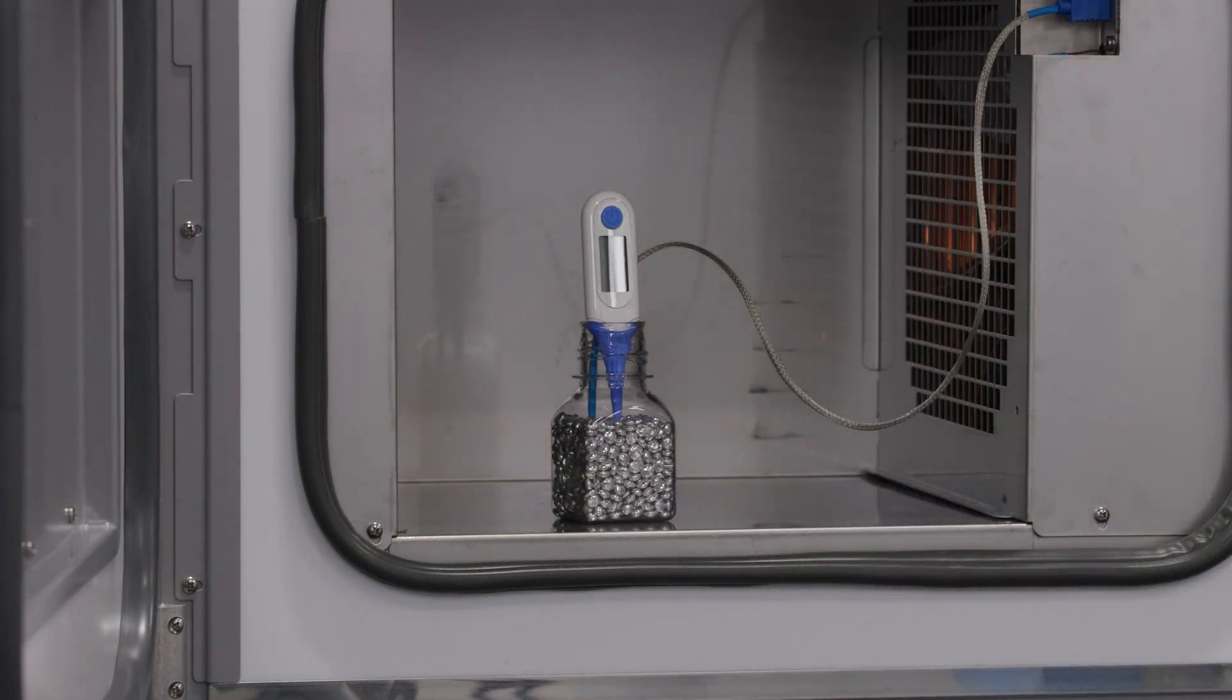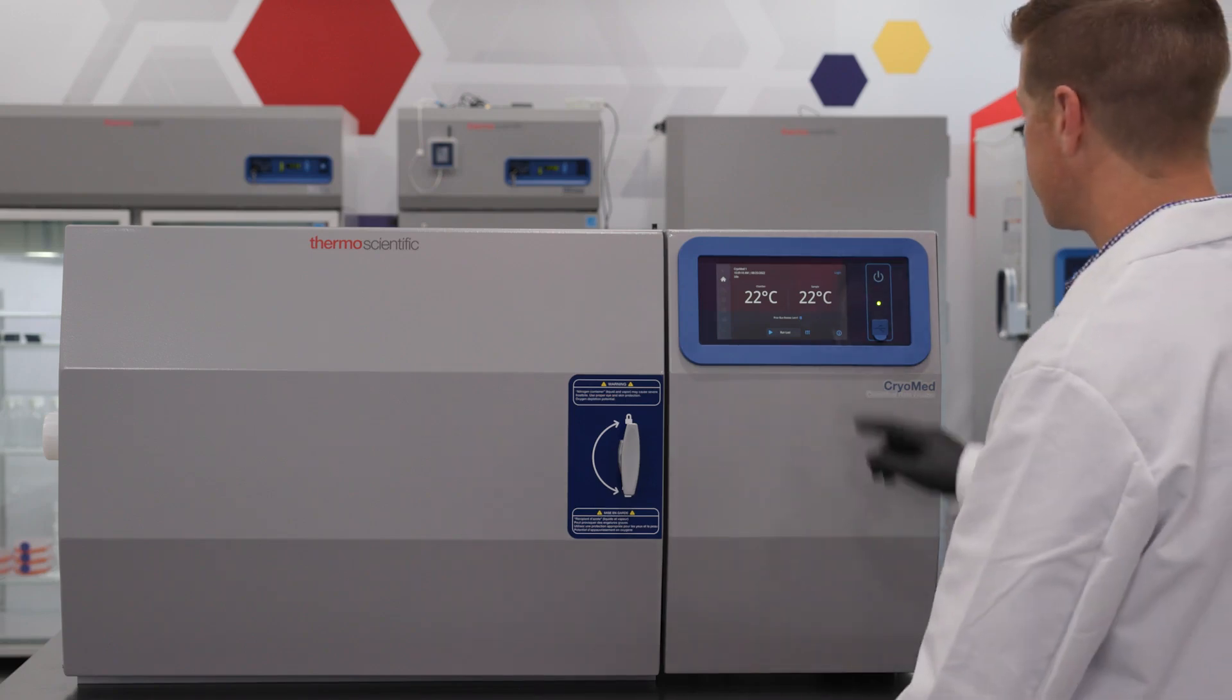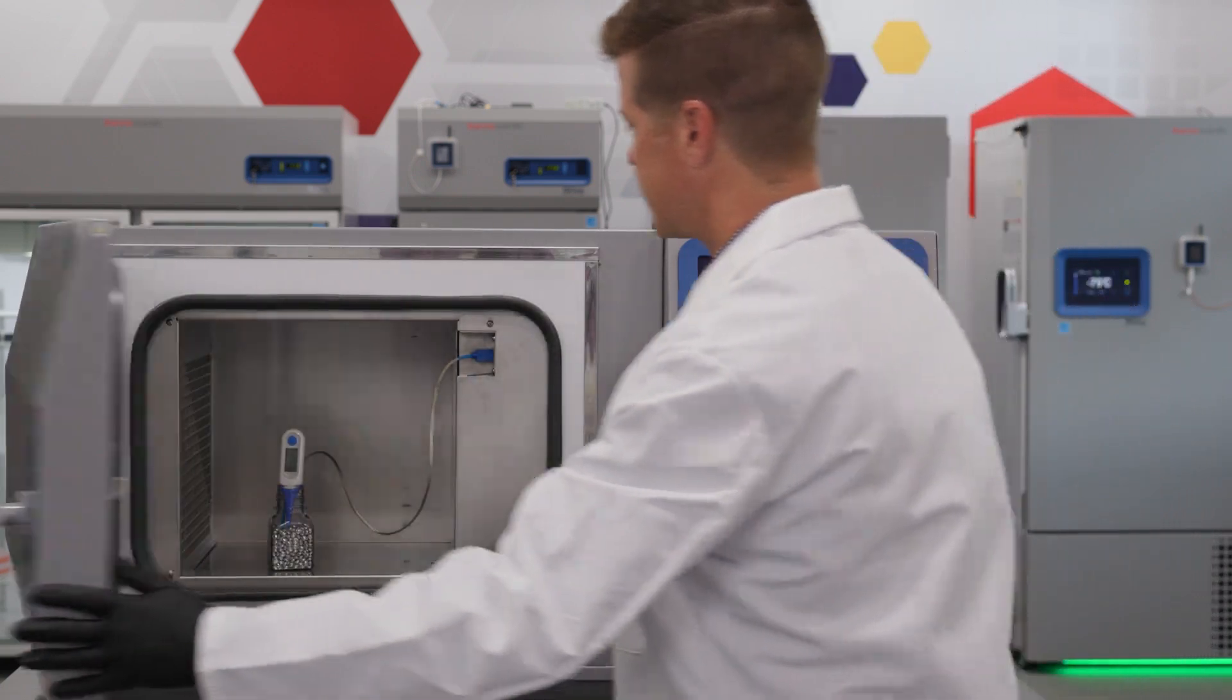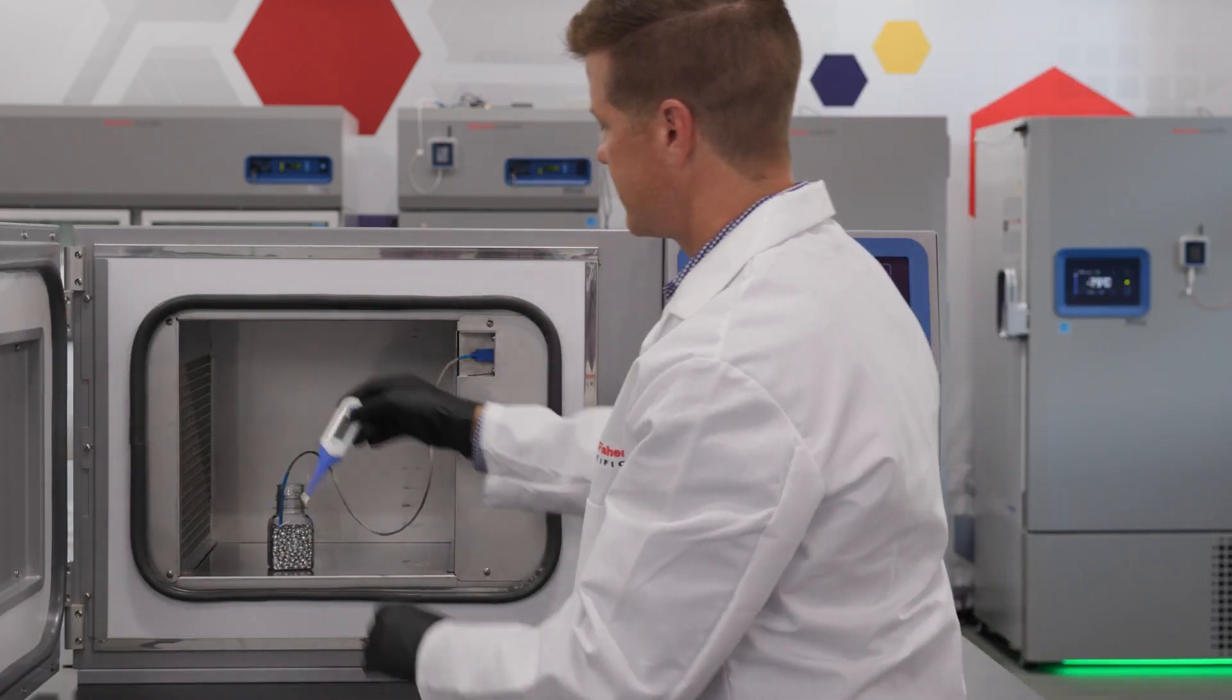or data logging device into the CryoMed chamber or sample and comparing the temperature reading on the CryoMed user interface to those reported on the secondary measuring instrument.